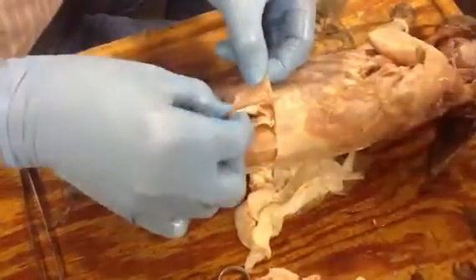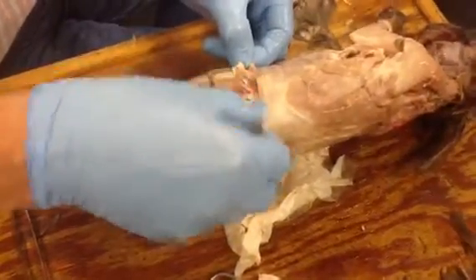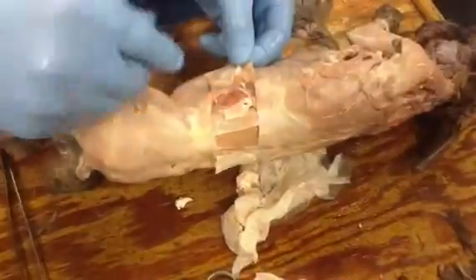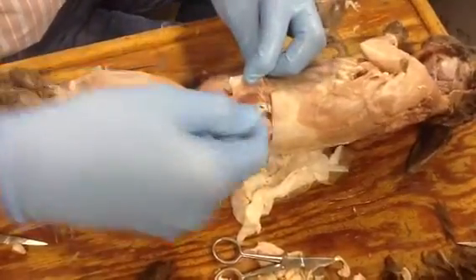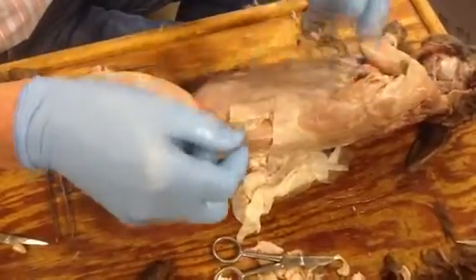The transverse abdominus runs more or less transverse, but it actually goes a little bit downward. External oblique is kind of pointing down to the pubis. Internal oblique is pointing up a little more towards the sternum. And transverse abdominus is pointing slightly downward. So you get three different layers, three different angles.